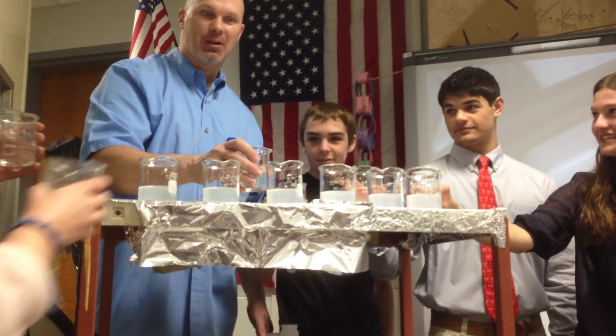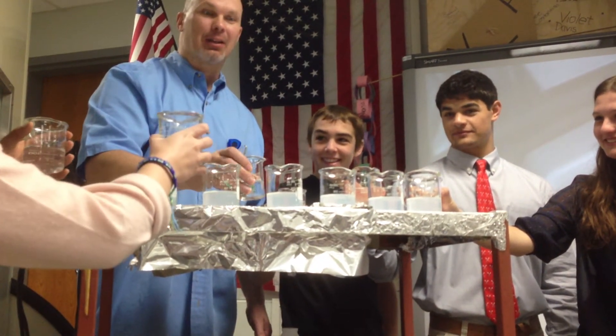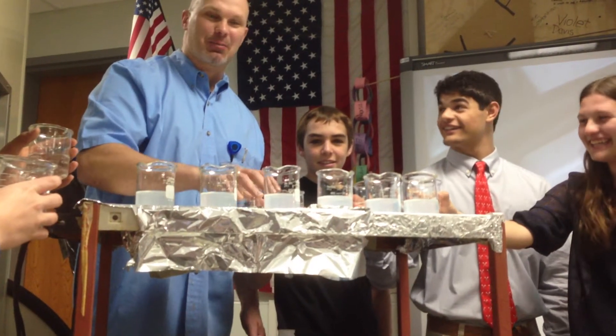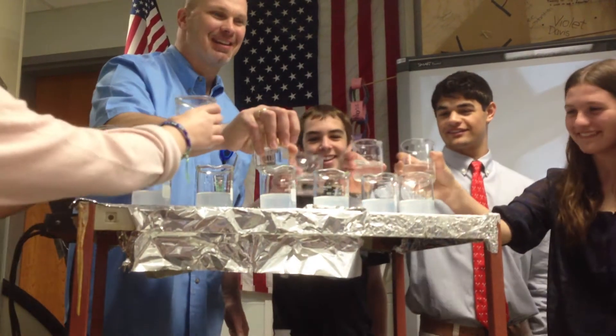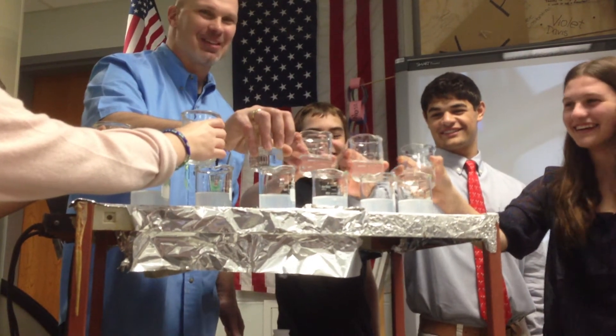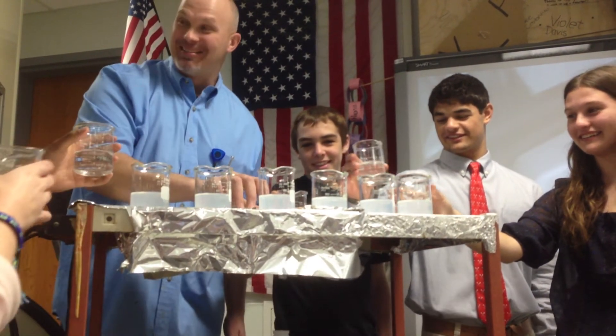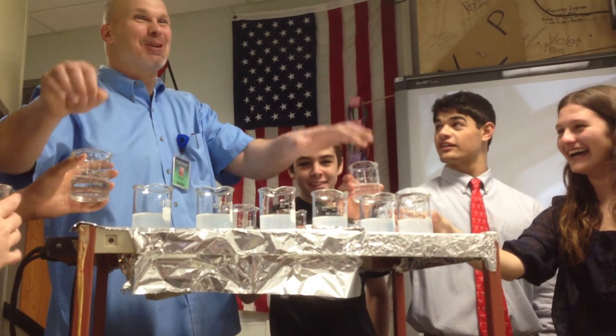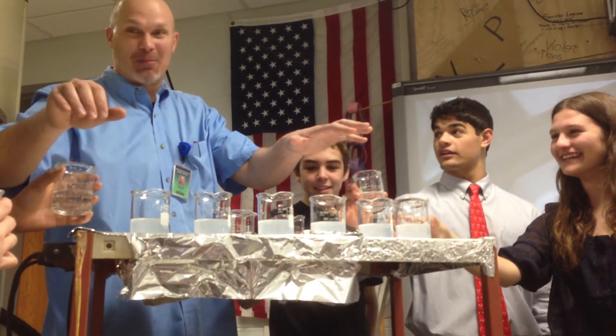Are you ready? Is this it? Yes. Let's test one more time. When I say one, two, three, just touch your beaker again. Okay, here we go. All right, now this is going to be it. I'm going to say one, two, three, and pour — and you pour at the same time. Are you ready?